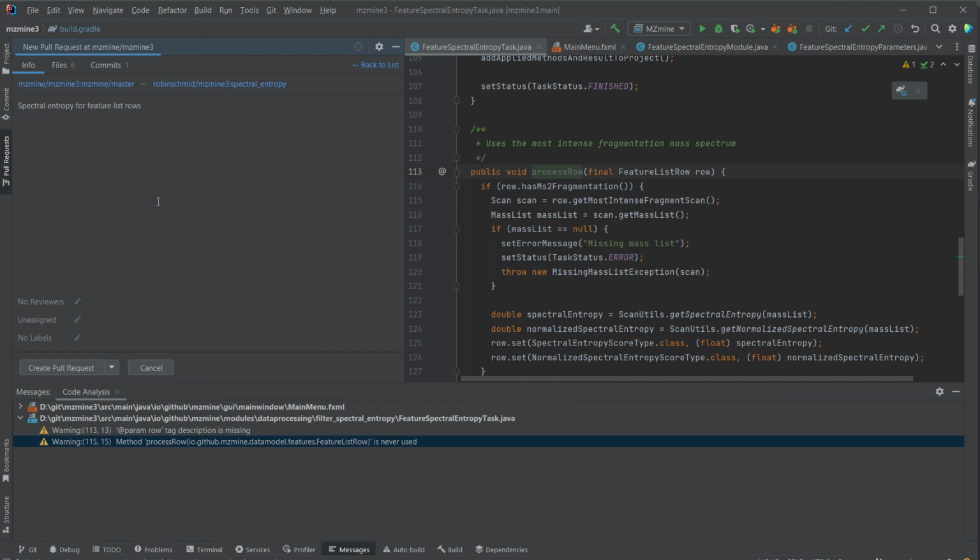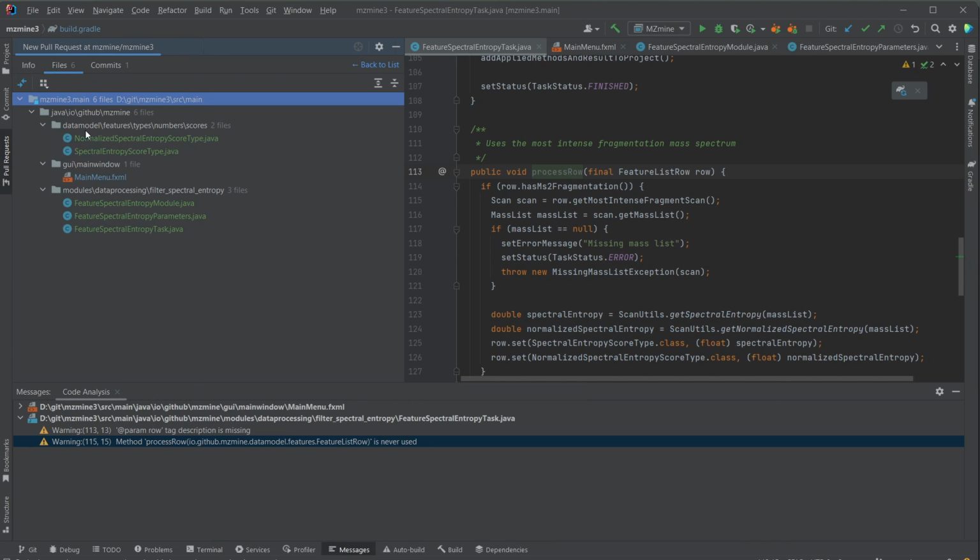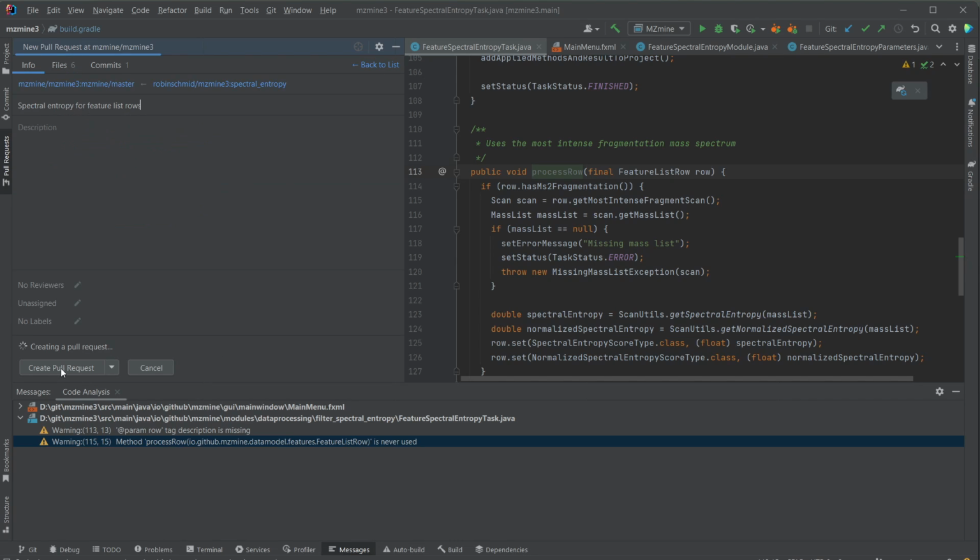We can add some description, and we should also add some description, like why it is used, what the outcome is, what the input is, and so on. We can add some screenshots to make it even easier to review. And we can again look at the files and the commits to see that there's no trash in there. So we did not accidentally change a whole bunch of other files, which sometimes happens if you rename some files, or if you rename some folder structure, then you rename hundreds of files. So it's very important that you check that this is reasonable, and then we can directly create a pull request and it is going to be online.